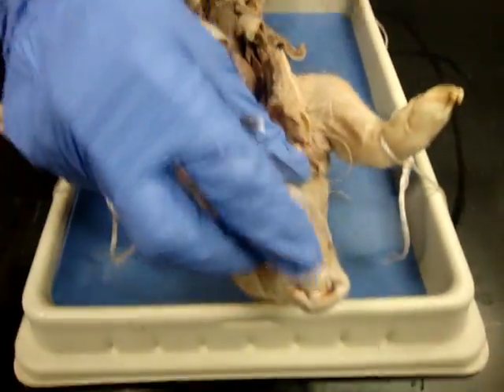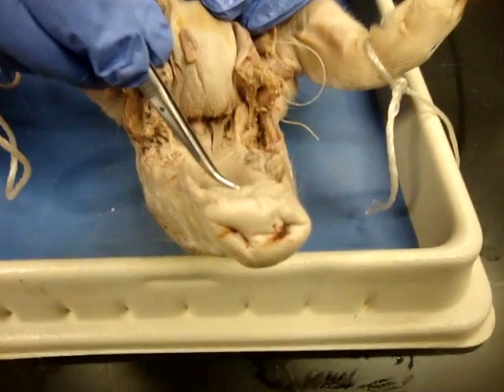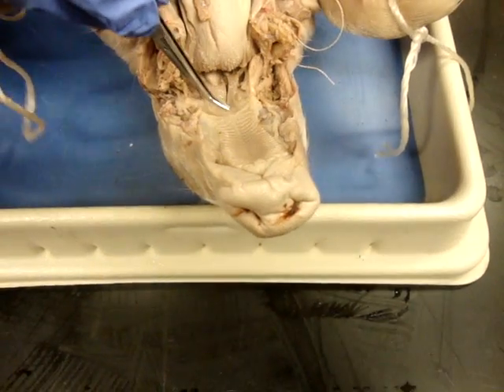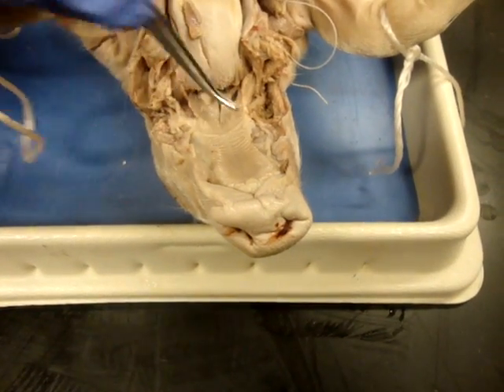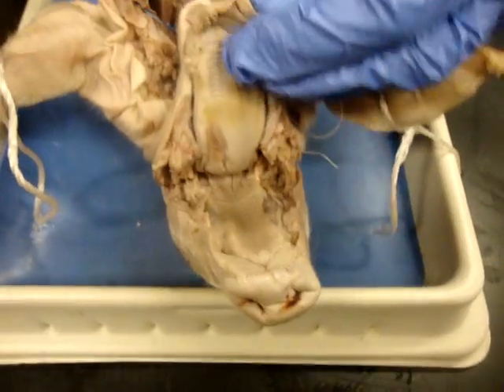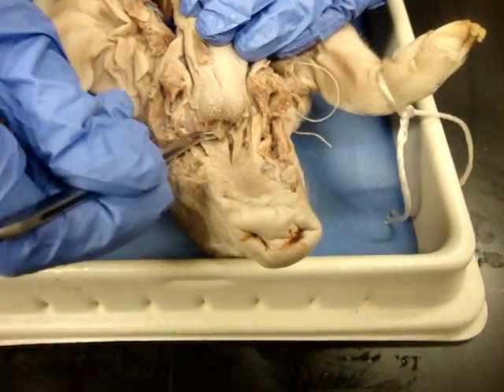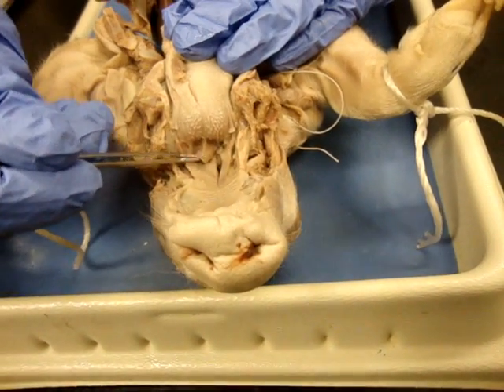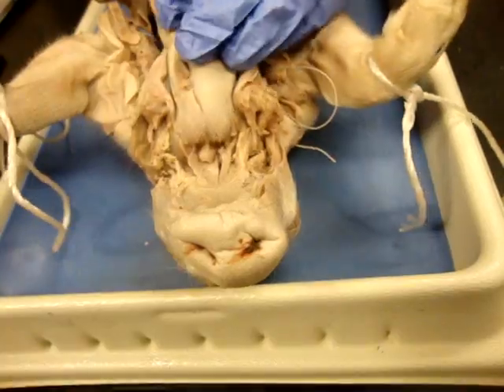If we take a look at the oral cavity of the pig, there are four things you need to know. You need to know the hard palate, which is towards the front of the mouth. The soft palate, which is towards the back of the mouth, similar to what we find in humans. You need to know the tongue. And then you also need to know the epiglottis, which is this flap that's right at the very back of the throat. The purpose of that is to keep any food from getting down the windpipe.